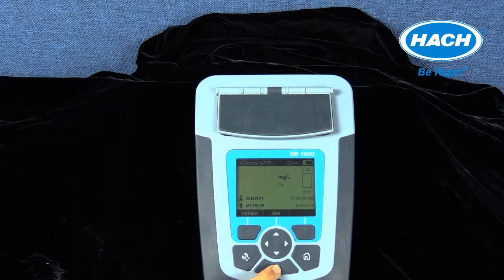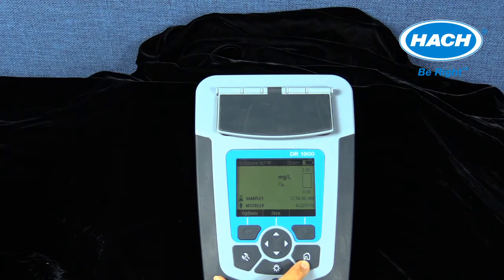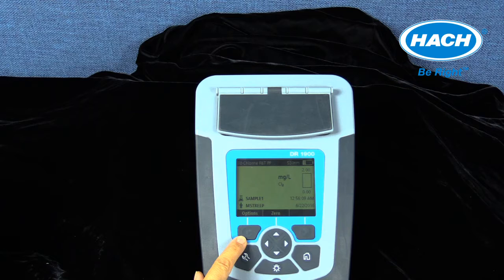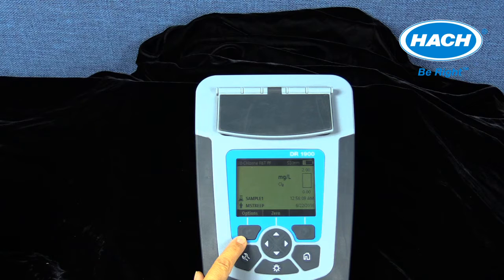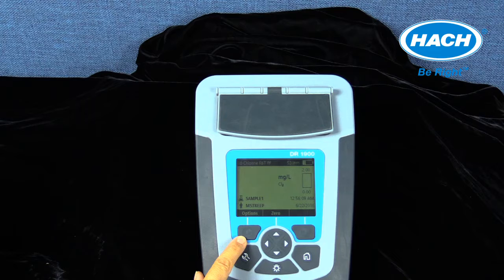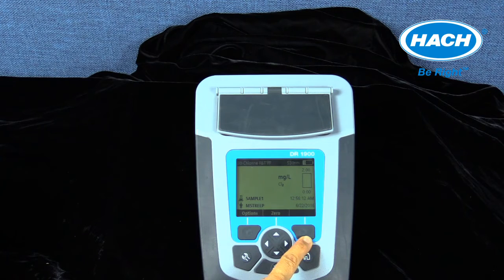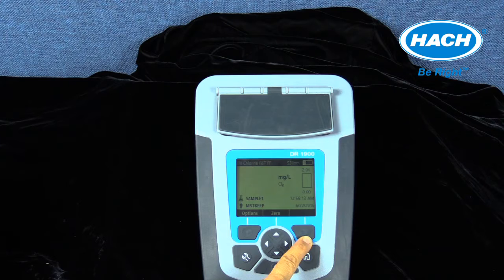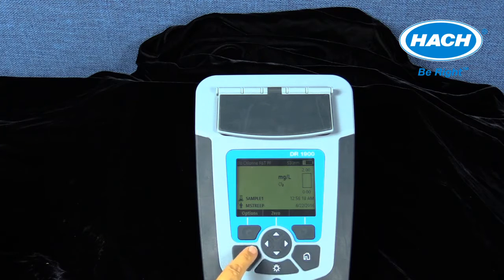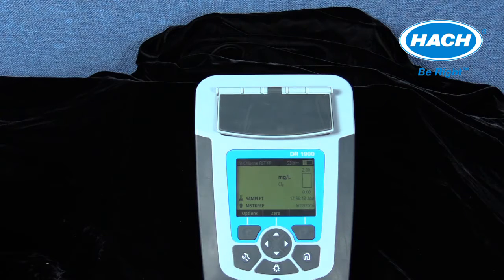The home key allows the user to progress to the main reading screen from the last measurement. The left key is a soft key that allows selection of options, cancels or exits a function, or moves to a previous screen. The right key is a soft key for reading a sample, selects or confirms an option, or opens a submenu. The navigation keys scroll through menus and enter numbers or letters.